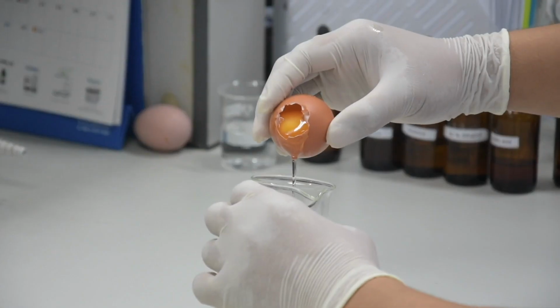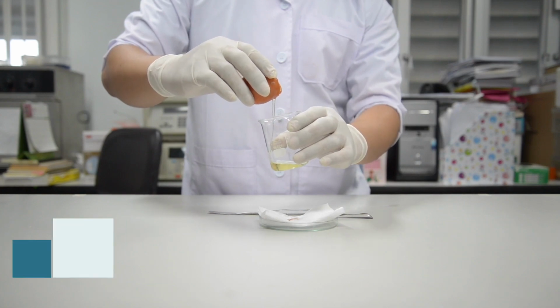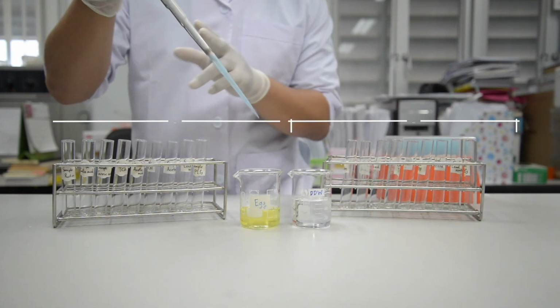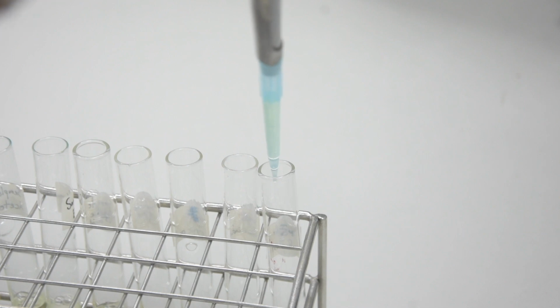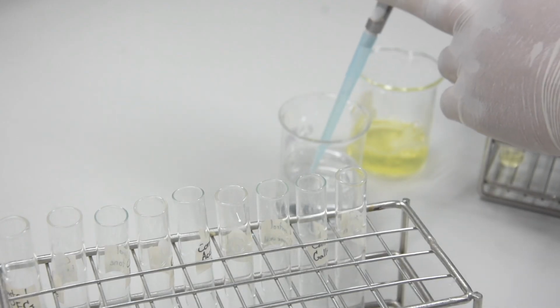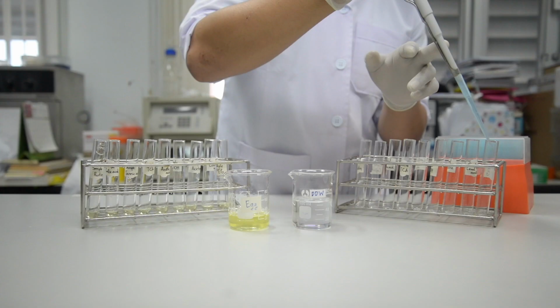First step, separate the egg white from the egg yolk. Pipette 1 ml of egg white into the prepared test tubes for the sample group. And then pipette 1 ml of distilled water into the prepared test tube for the control group.